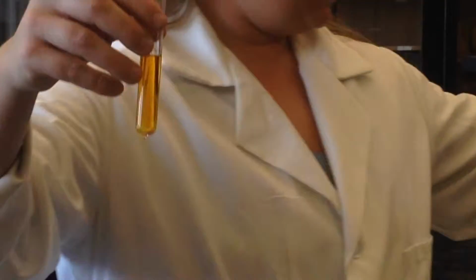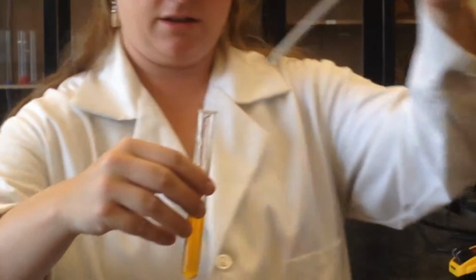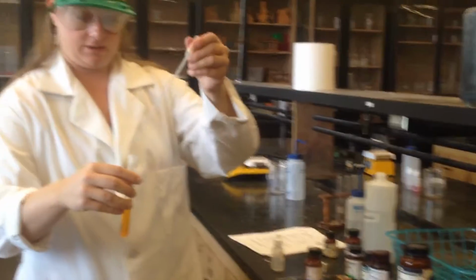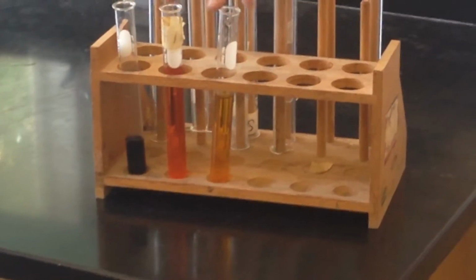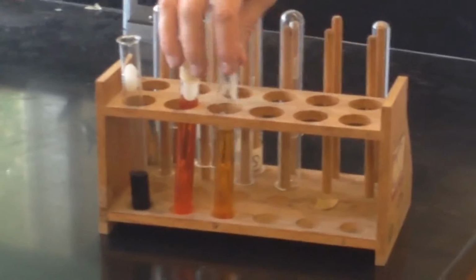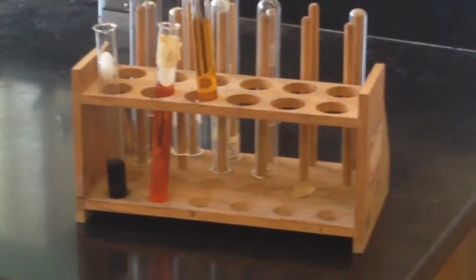Oh man. Nope, it turns orange. So it turns kind of orangey. Keep adding this. We did get a slight color change, okay? So it was light yellow and then it turned orange. So the reds and the oranges are very subtle, so you have to really take descriptions of what color it was before you added the substance.